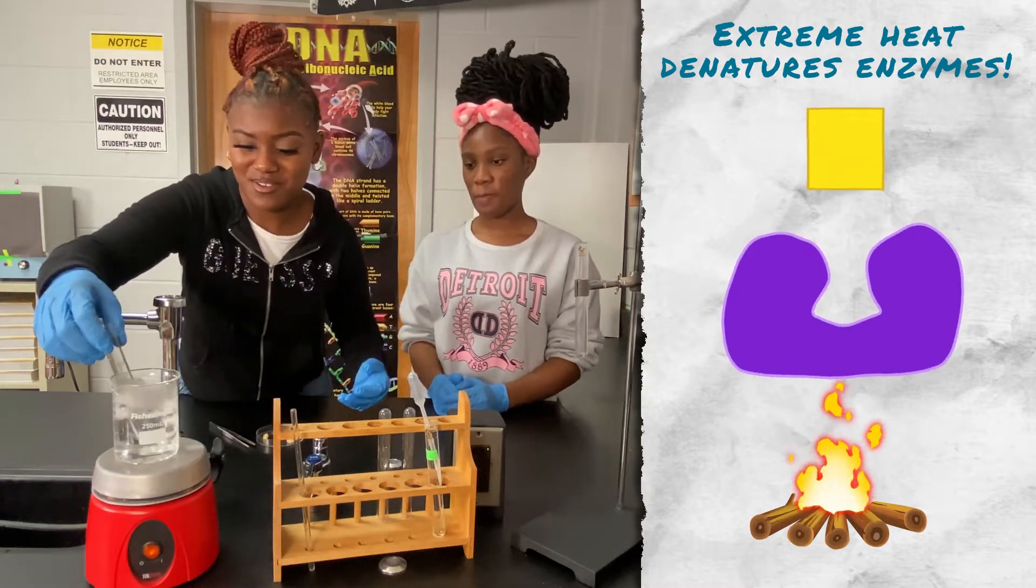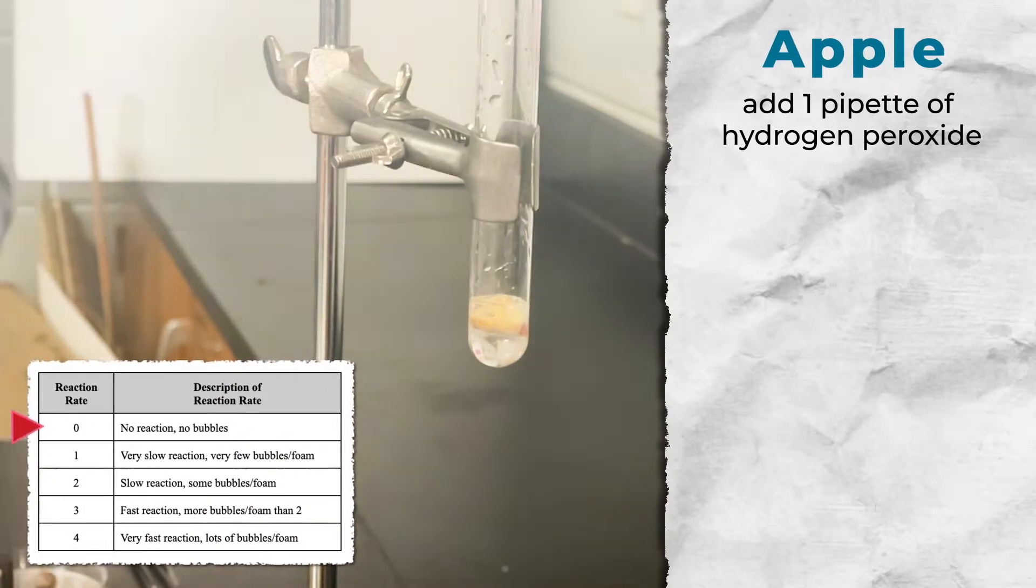My partner is about to put the piece of apple inside the test tube with a pipette of hydrogen peroxide.